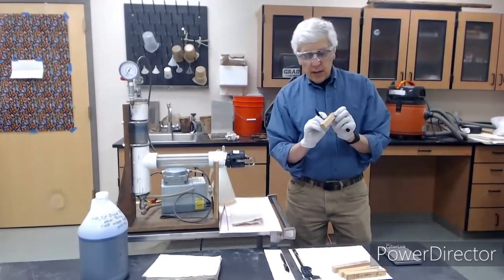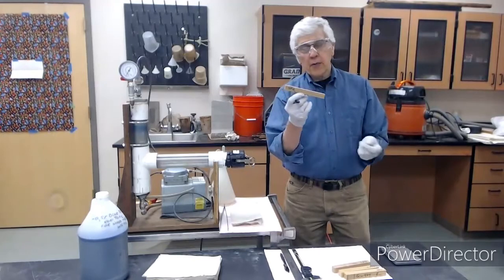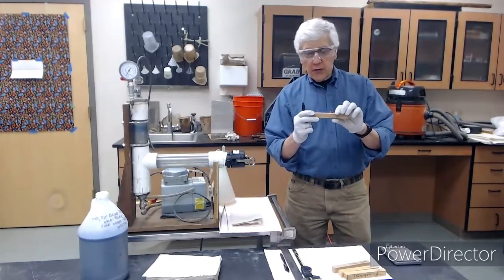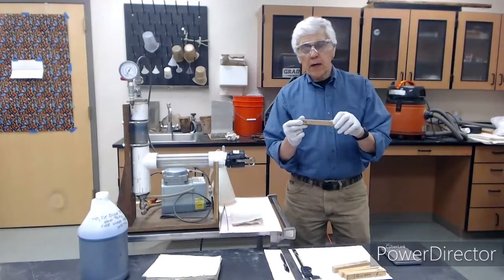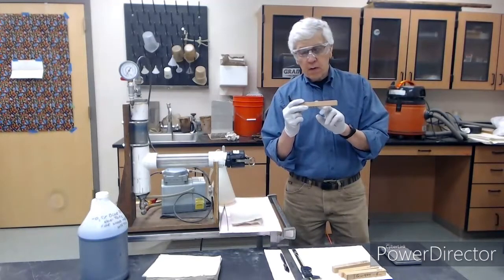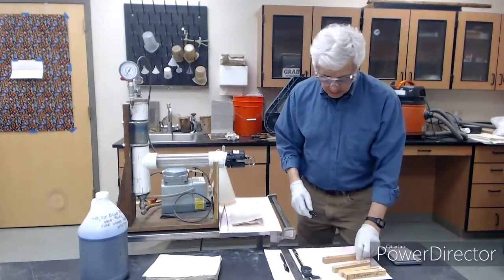DF2 has a defect. Somebody has stapled it. This is actually pretty common when they treat wood: they will staple an identifying label on it. So yeah, that'll be interesting to see what happens to penetration in those spots.